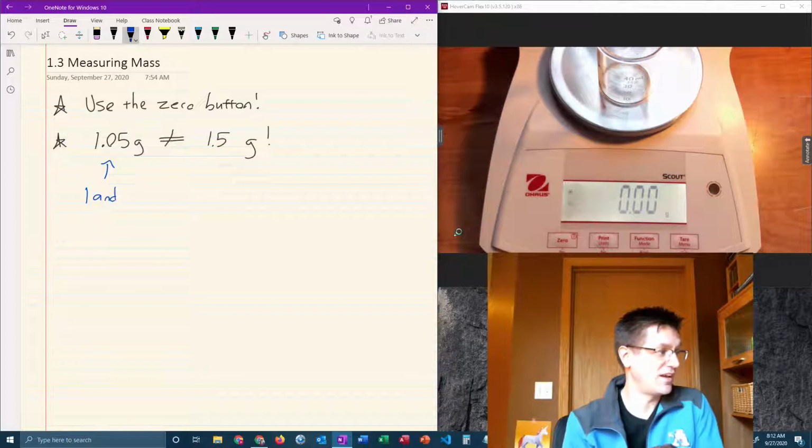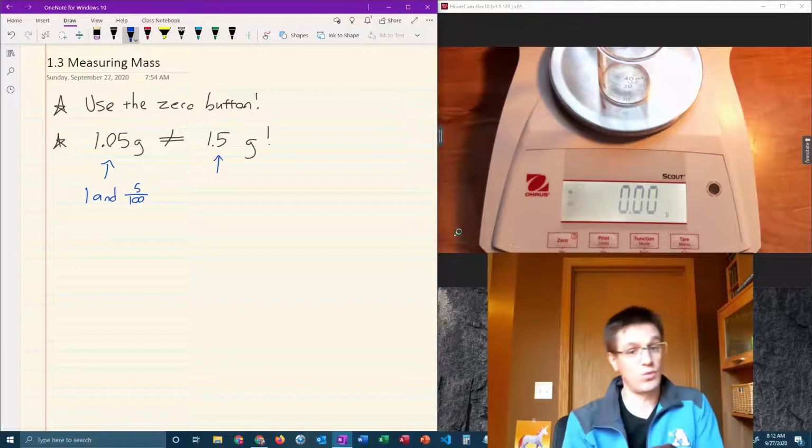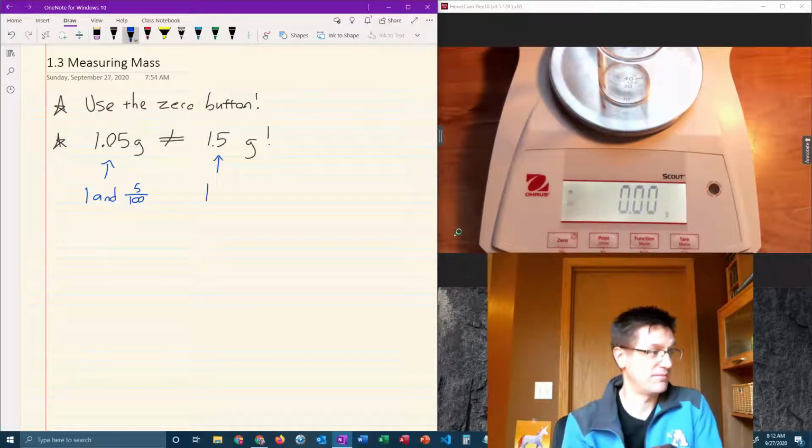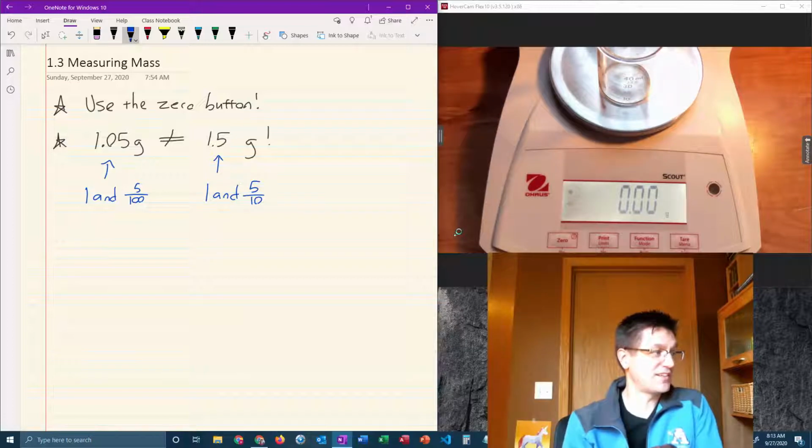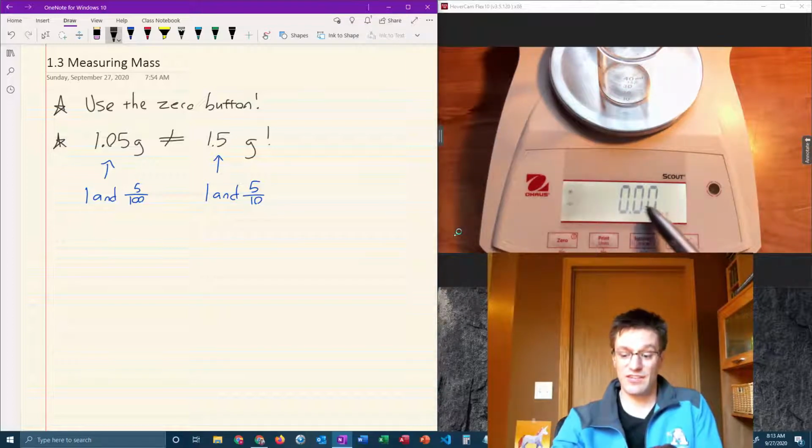1 5/100ths. This is 1 5/10ths of a gram. Totally different numbers. Something similar to that is, if you're looking for 1.5, you'll notice on the scale we actually have 2 decimal places. So what we're looking for is a 1 here and a 5 right here and a 0 in the last place. So what that tells us is that 1.5 is actually the same as 1.50.